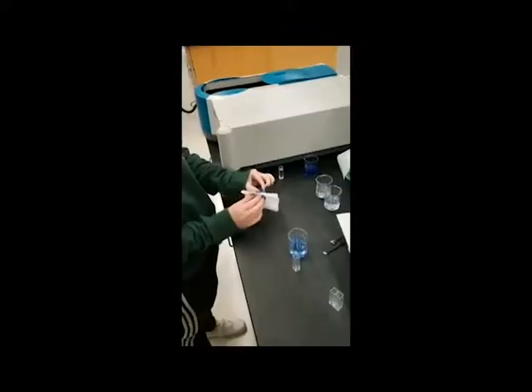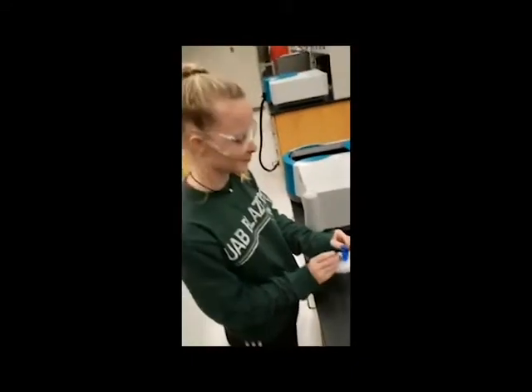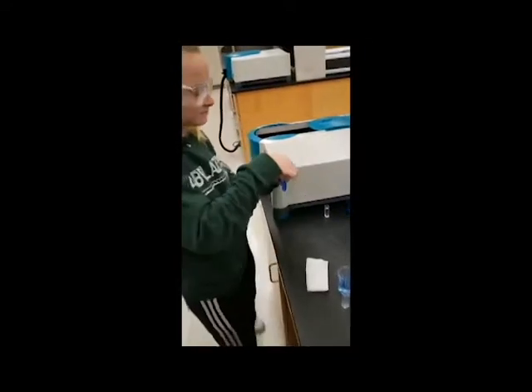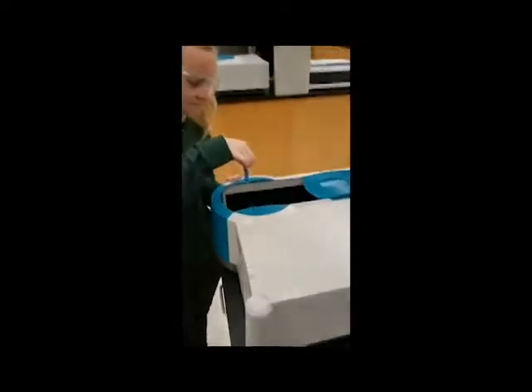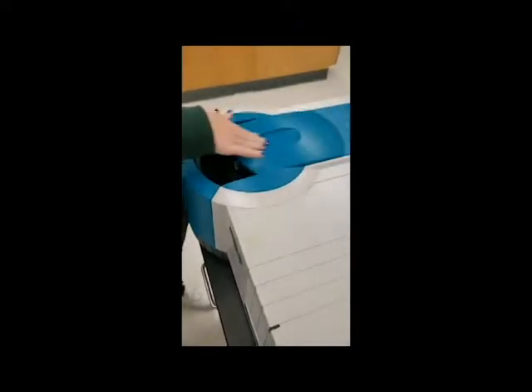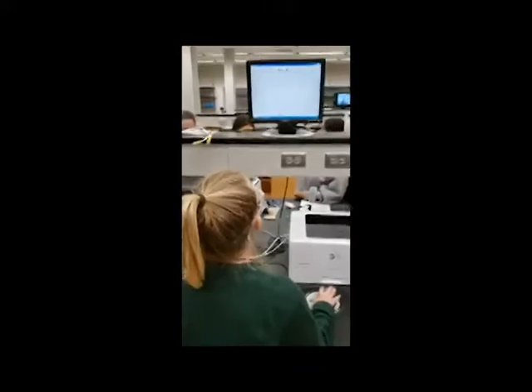Using cuvette wipes, wipe two sides of the cuvette that are opposite each other to get rid of any particles that could affect your readings. Place the cuvette into the spec with the clean sides in the beam's path. Close the spec fully before scanning the sample.